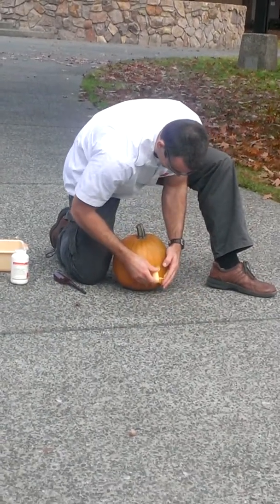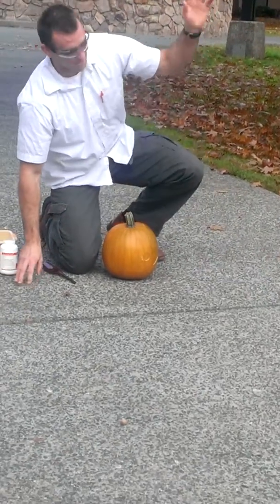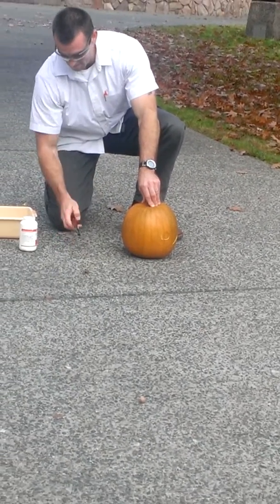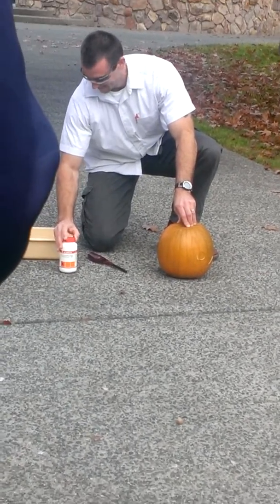I really don't. We did this one time at the demo that nearly blew the blast shield away, and then the next time it just kind of did that. So we'll let it fill with a little bit more. Maybe we should put in more of the tablets. It's not the tablet's fault.